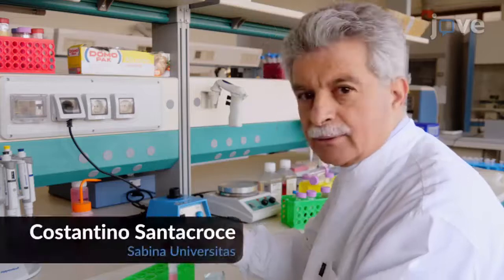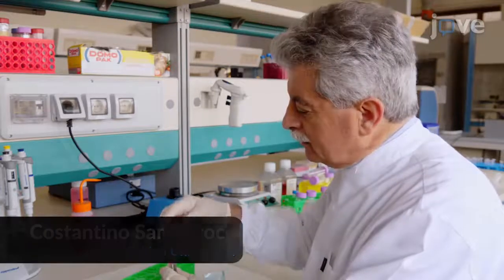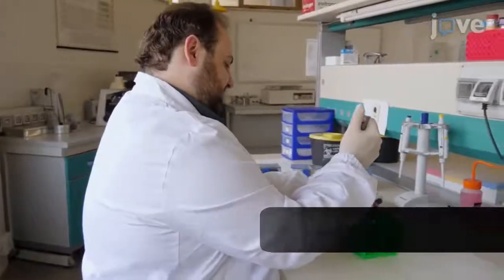The procedure for opening the tooth will be performed by Dr. Constantino Santacroce. Subsequently, the protocol will be shown by Stefano Martellucci, the PhD student from my lab who is the first author of the article.